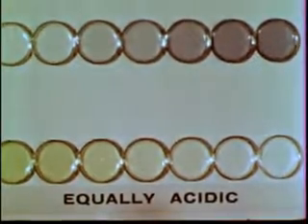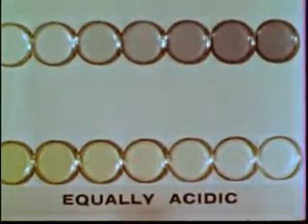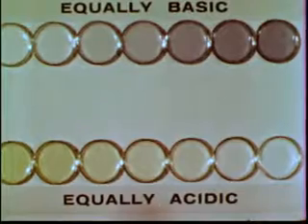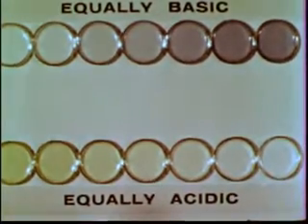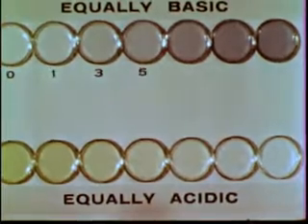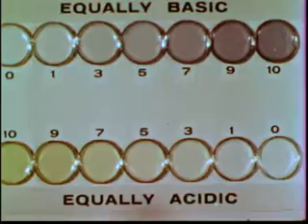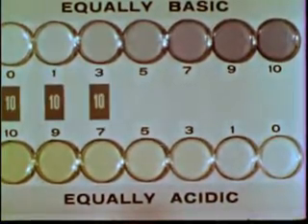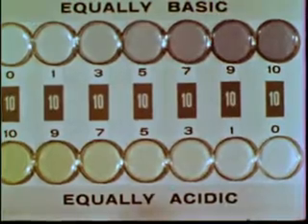They contain mainly yellow HBB. The solutions in the blue row are all equally basic. They contain mainly blue BB minus. The number of drops of indicator added to each dish is shown. A total of 10 drops has been added to each pair of dishes, although the ratio of blue to yellow ions varies.